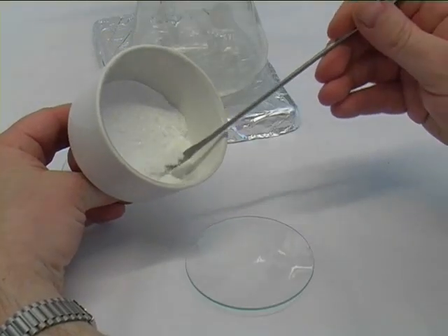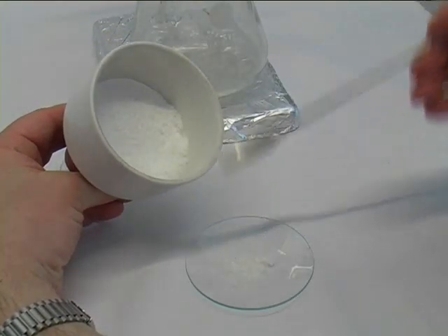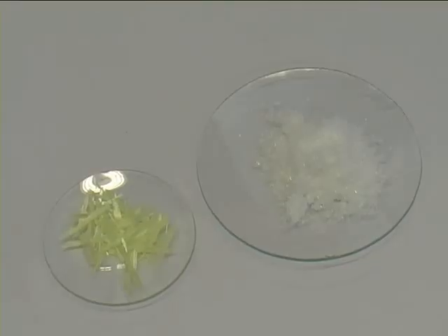And you are ready to collect your crystals onto the watch glass. After you have transferred all the solid onto a watch glass, you can dry them using a vacuum desiccator.